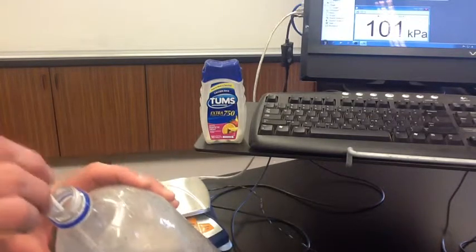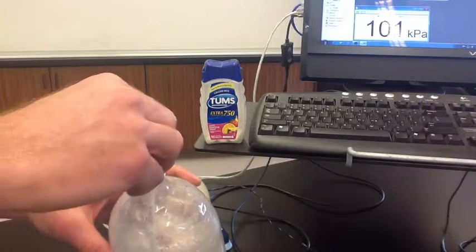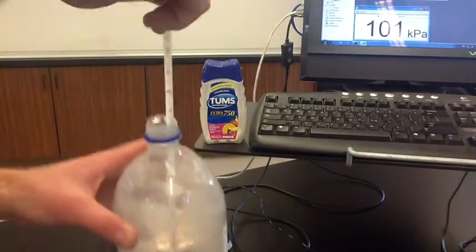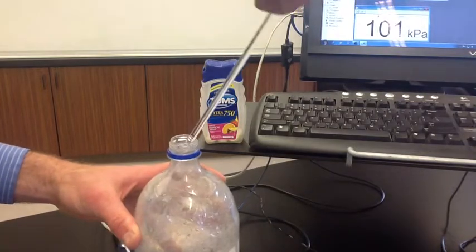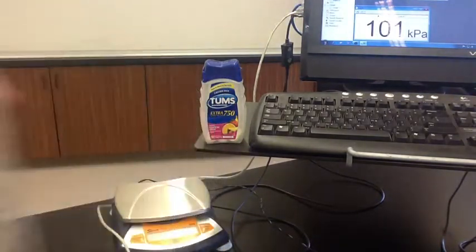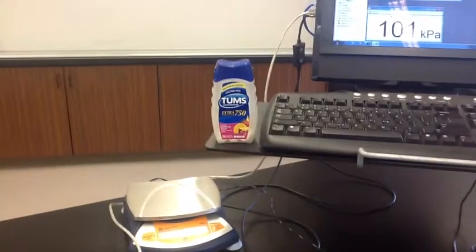You can use that to figure out what percent was calcium carbonate. We're measuring the temperature inside the bottle with a thermometer, and it is 21 degrees Celsius inside the bottle right now.